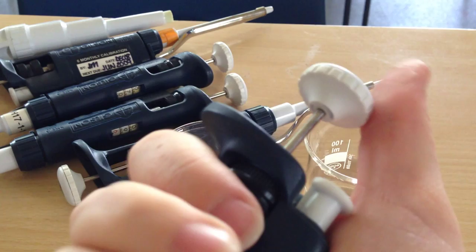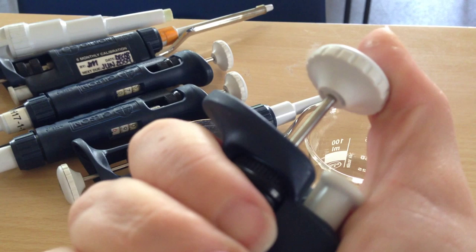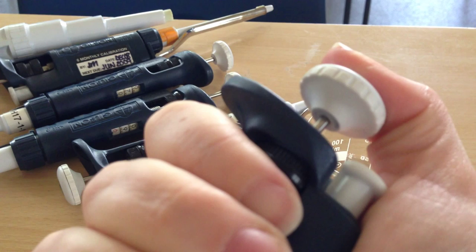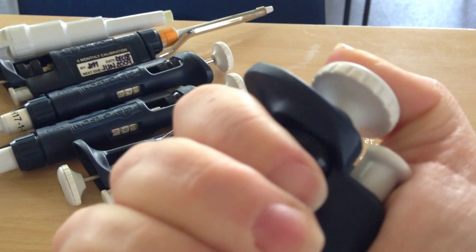So I'll just show you that from this end. You need to press it to the first stop. Slowly release it so you're sucking up the water. When you've got it full of water transfer it. Slowly depress it and then do the second stop.